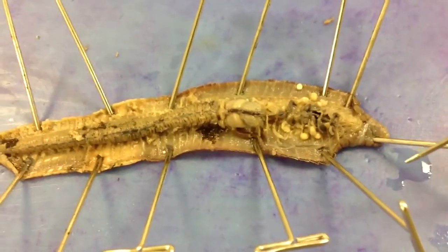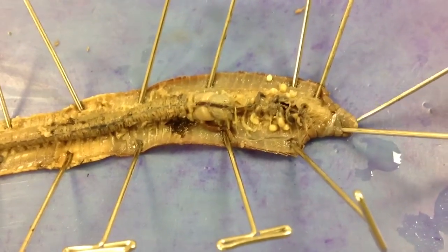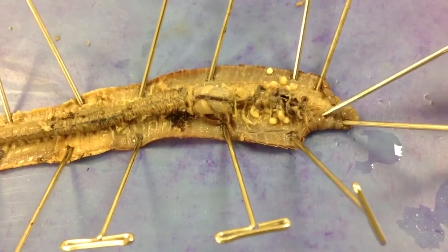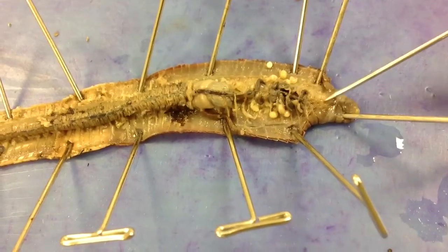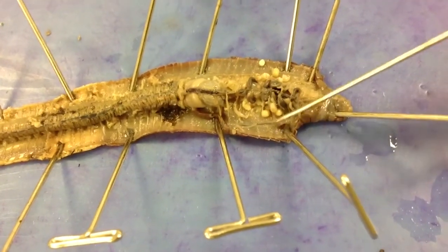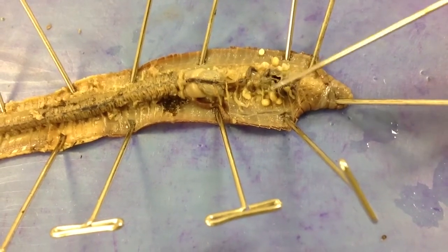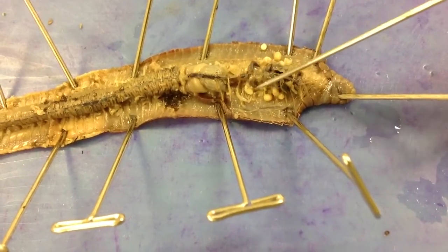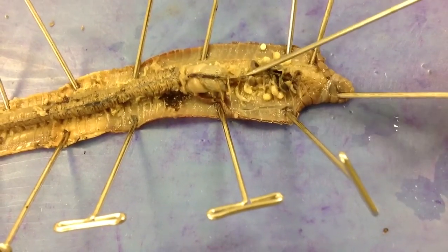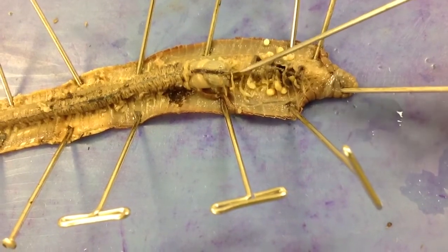Starting here at the anterior end, the mouth leads into the pharynx. The pharynx leads into the esophagus. The esophagus is running underneath these structures here. It's a whitish-colored tube.